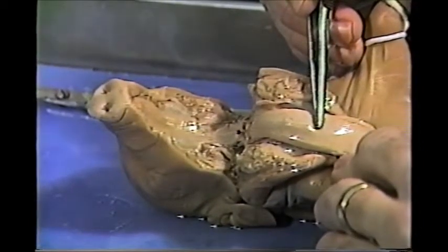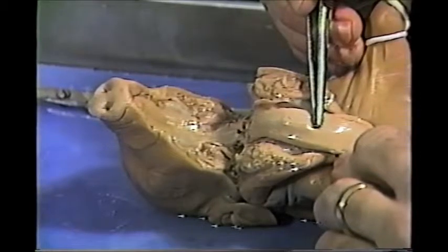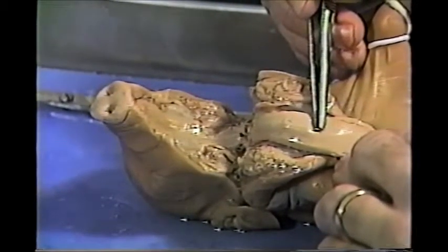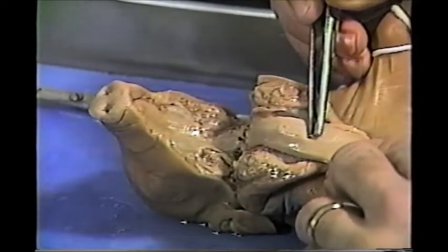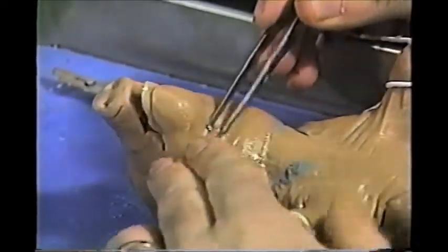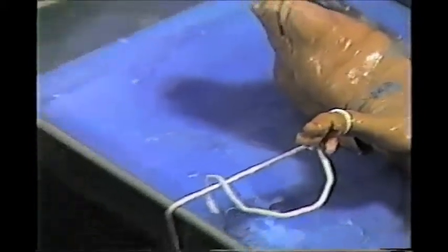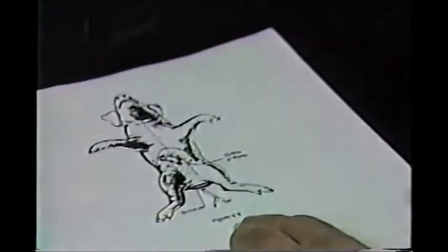So these are the primary features that we're going to see in the mouth. There are other structures, but they're not very well developed in the fetal pig, so we're going to skip them. Okay, the next thing, you put the lower jaw back, and in your lab book there is a dissection guide, figure 6.8.